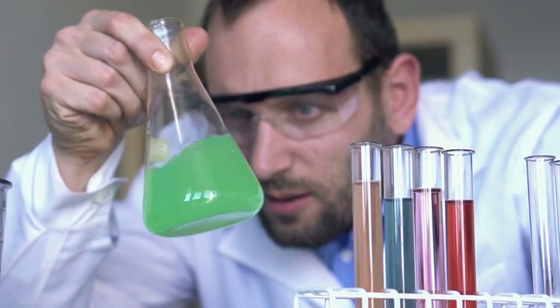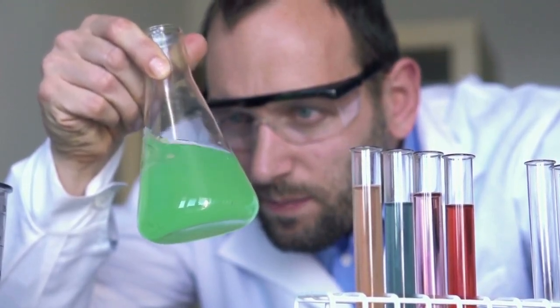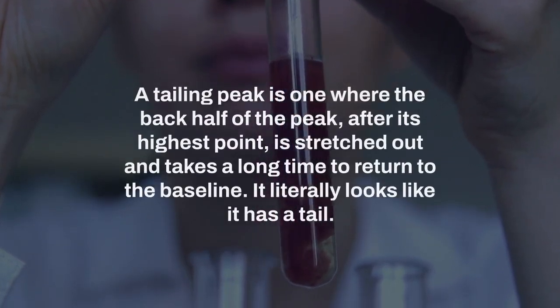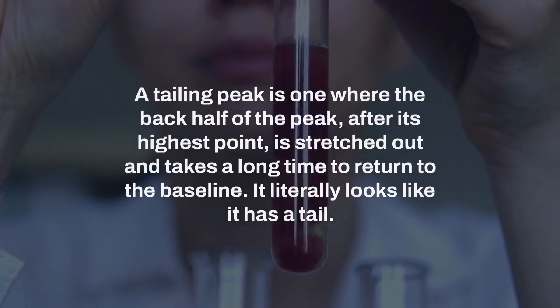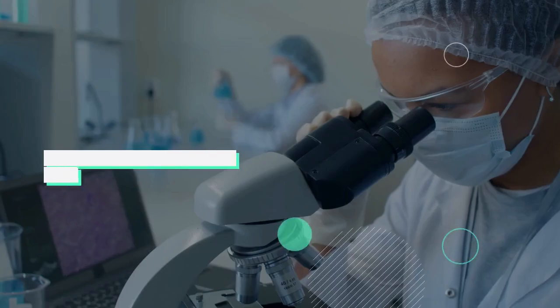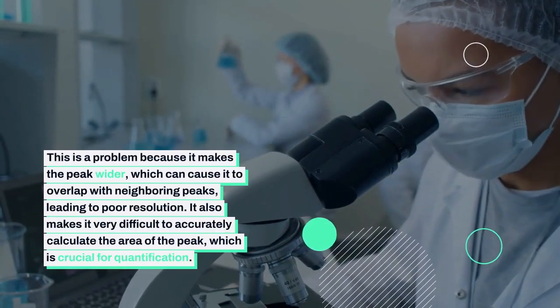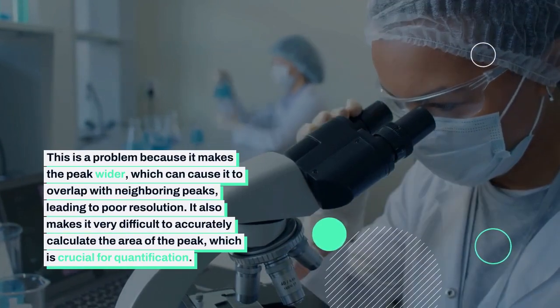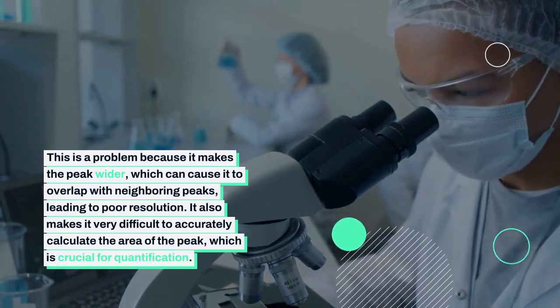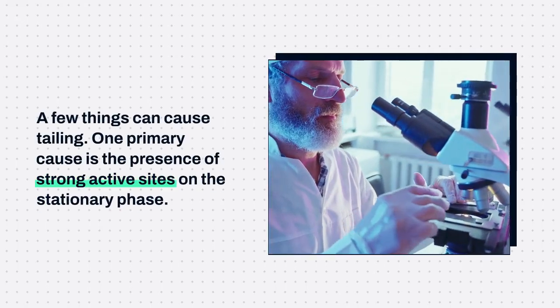Let's first look at peak tailing. This is probably the more common issue of the two. A tailing peak is one where the back half of the peak, after its highest point, is stretched out and takes a long time to return to the baseline. It literally looks like it has a tail. This is a problem because it makes the peak wider, which can cause it to overlap with neighboring peaks, leading to poor resolution. It also makes it very difficult to accurately calculate the area of the peak, which is crucial for quantification. A few things can cause tailing.